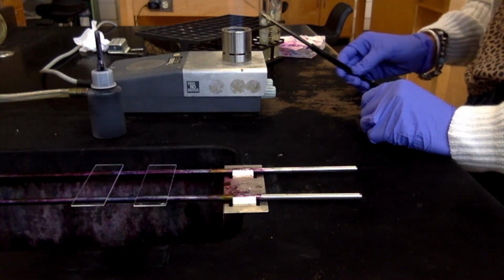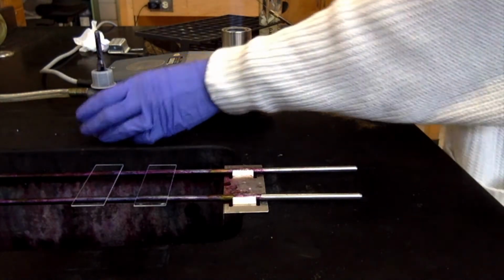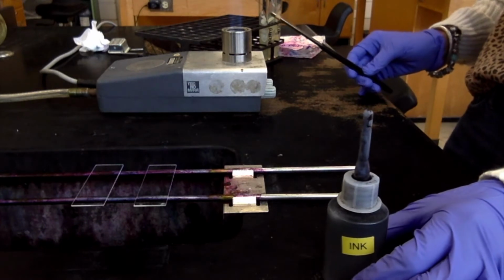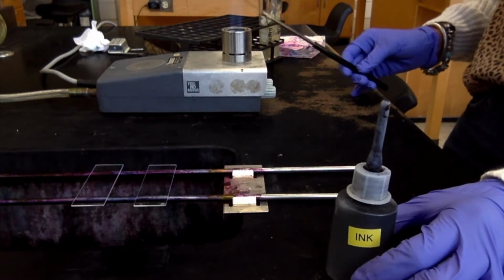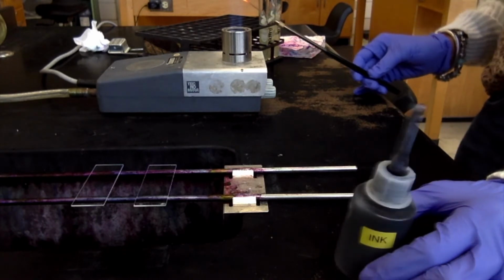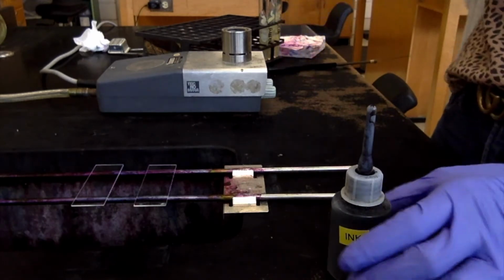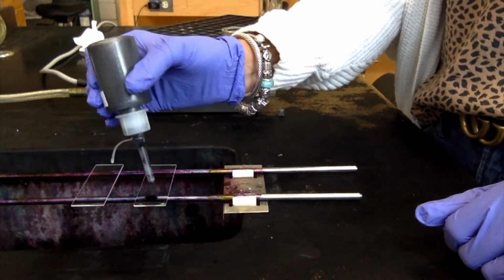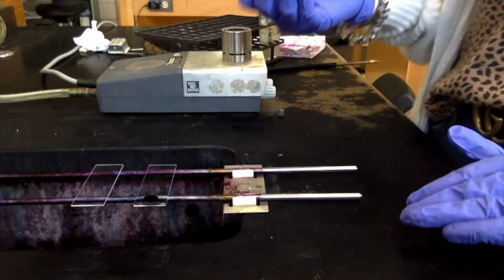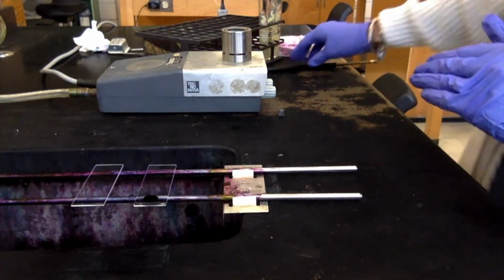The anionic dye that we're going to use today is called black ink or nigrosin ink, and it literally looks like black ink. So we are going to put a drop of the black ink on one side of one of the slides. Really you only need 1 drop. You don't want to put too much because then it's just going to look jet black and you're not going to be able to see anything under the microscope.